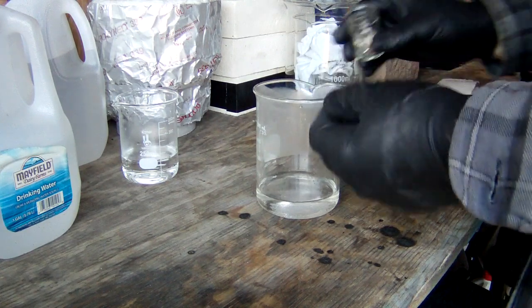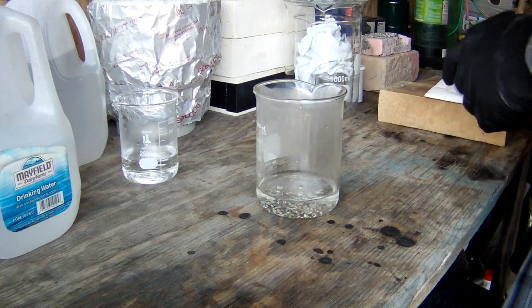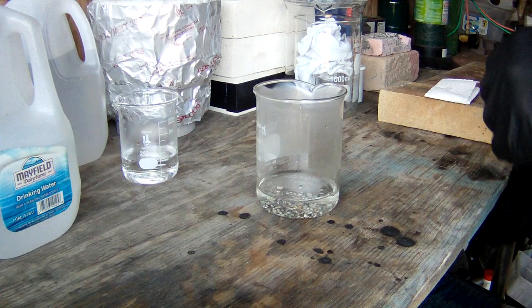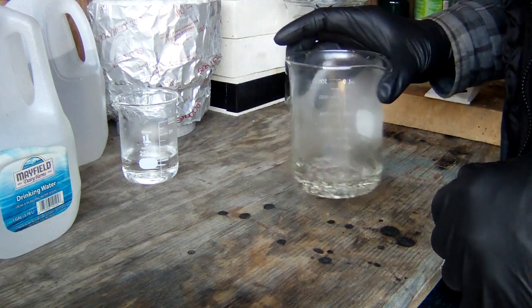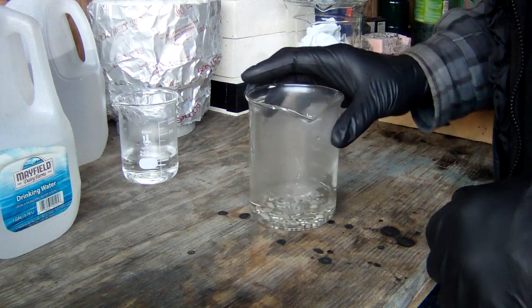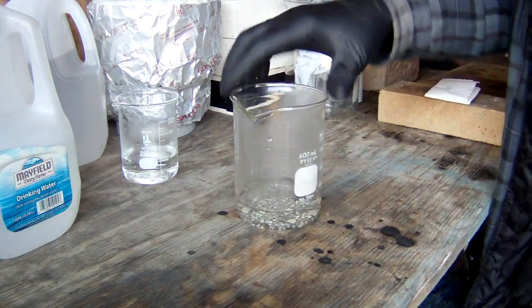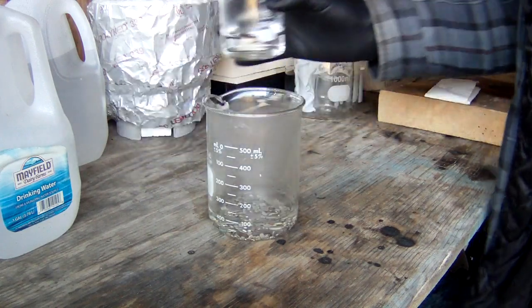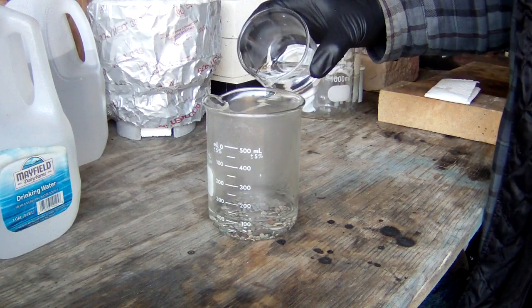So we're going to go ahead and dump the contacts in there. I think we had 77.64 grams or something along those lines. 77 grams anyway. So I'm going to go ahead and get those in there. I'm going to add a little bit of nitric right here. And then we'll set her up on the burner and go from there.